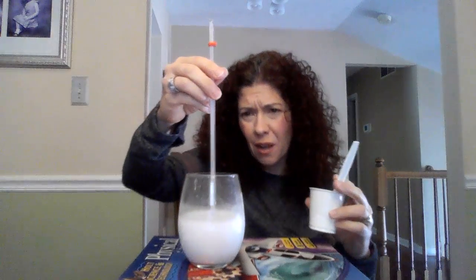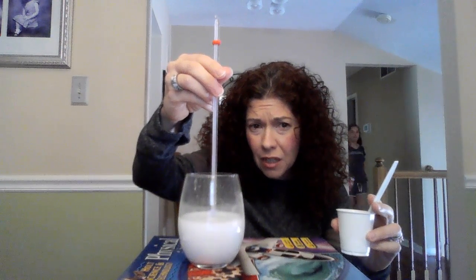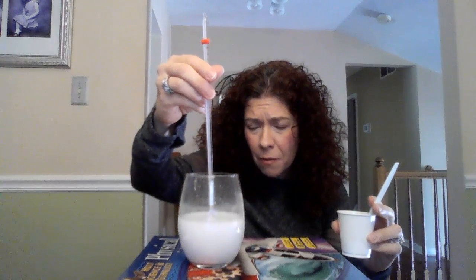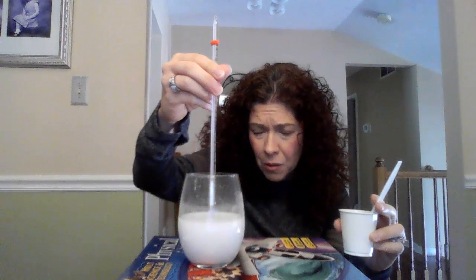You can see that there's some bubbling happening, which is a release of a gas. We've now gone to more of a milk color solution, a white solution. And I'm looking at the temperature, and the temperature is up to 29 degrees Celsius. We want to wait and make sure that that is as hot as it's going to get. Yeah, so we're up to 29 degrees Celsius.